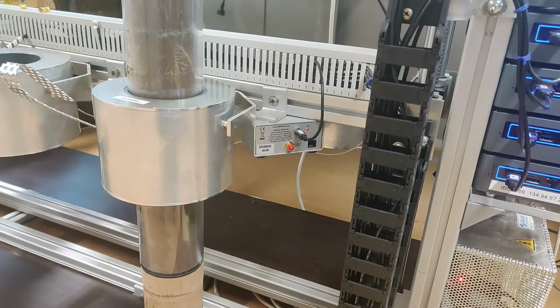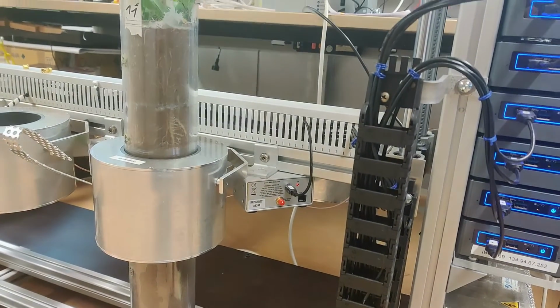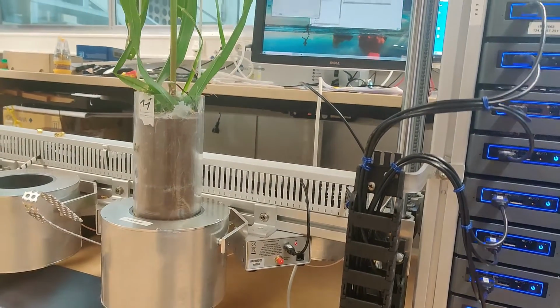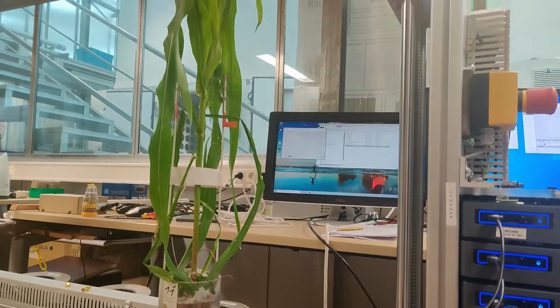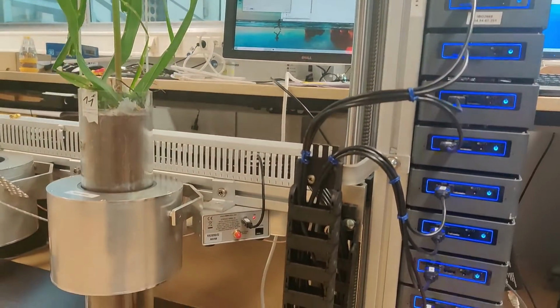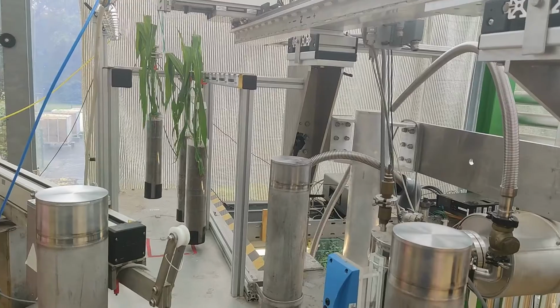Together with MRI images, daily weigh-ins for calculating transpiration, shoot length measurement, and leaf number count, the soil water profiler was used to measure soil moisture in each layer and to determine how it varied on a daily basis due to root water uptake.